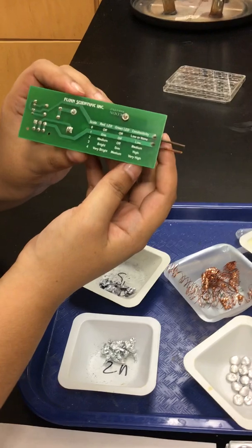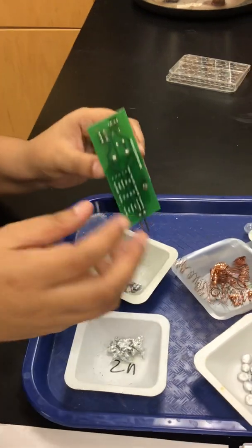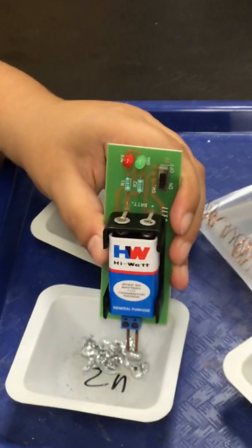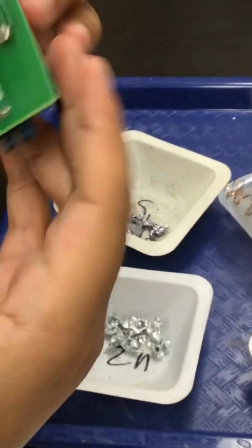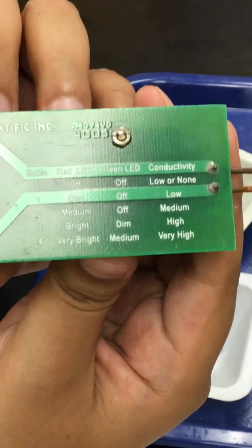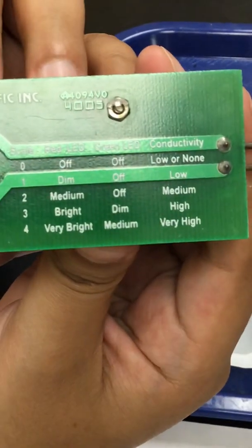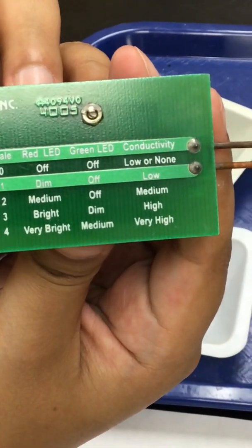All right. We'll put a key on there for conductivity. We'll add a key to your Google Classroom. Okay. The next one is, I can't see. Hold on. Zinc. Turn it back around. I think I found the adjustment there. So tip it just a little bit. We got a little bit of glare there. Okay. So, yeah, there you go, guys. There's the key. Write that down. Pause the video if you need to.